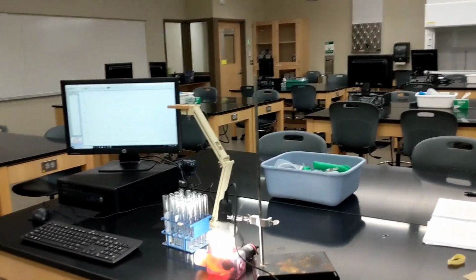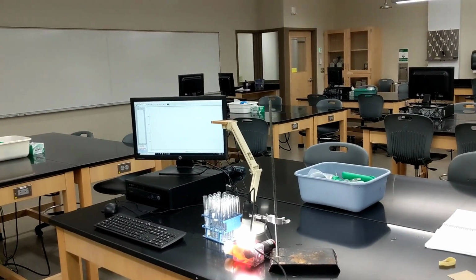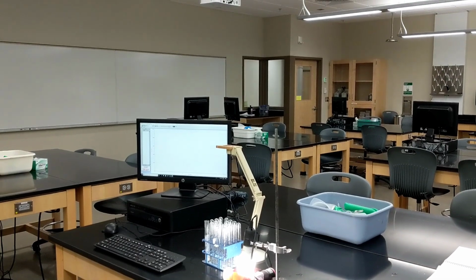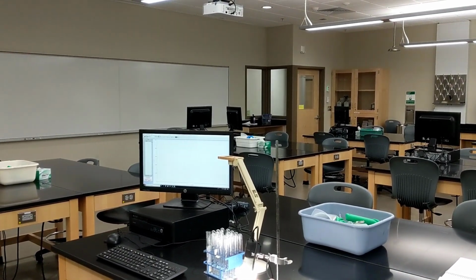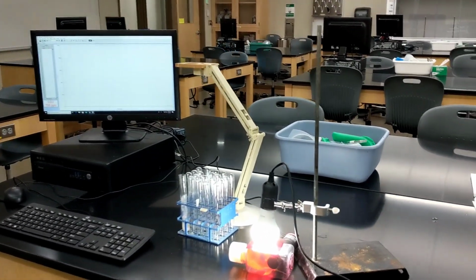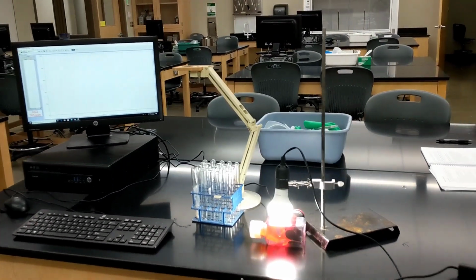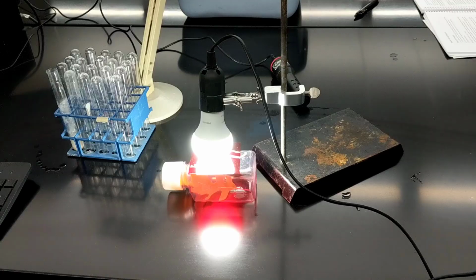So your job would be to write a hypothesis or several hypotheses that take into account what the plant would do with carbon dioxide at red, white, blue, green, and no light. Okay, I think I got all of them listed there. And we would run this and replicate everything so we can get enough data to make a figure with error bars and things. So I'll come back in just a second.